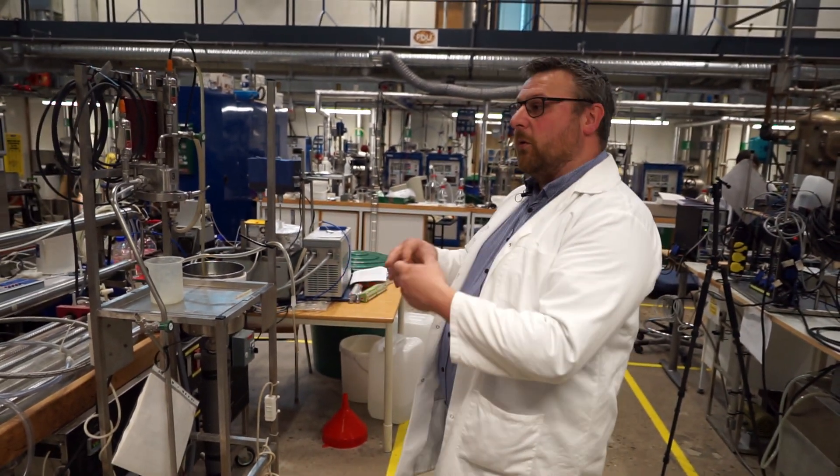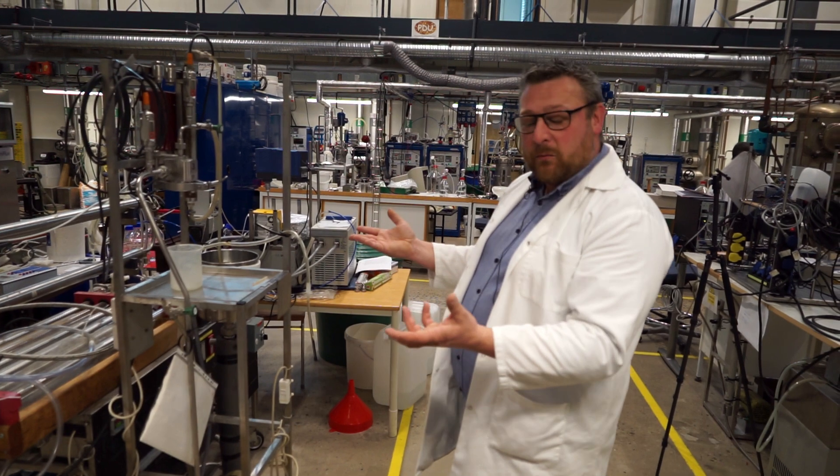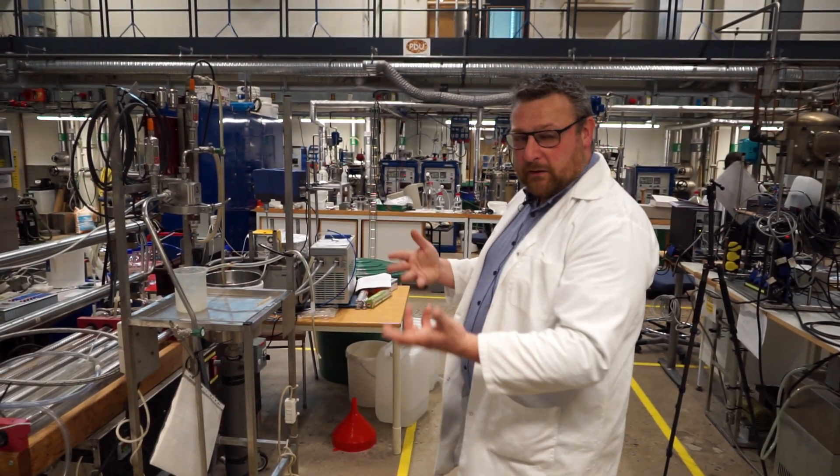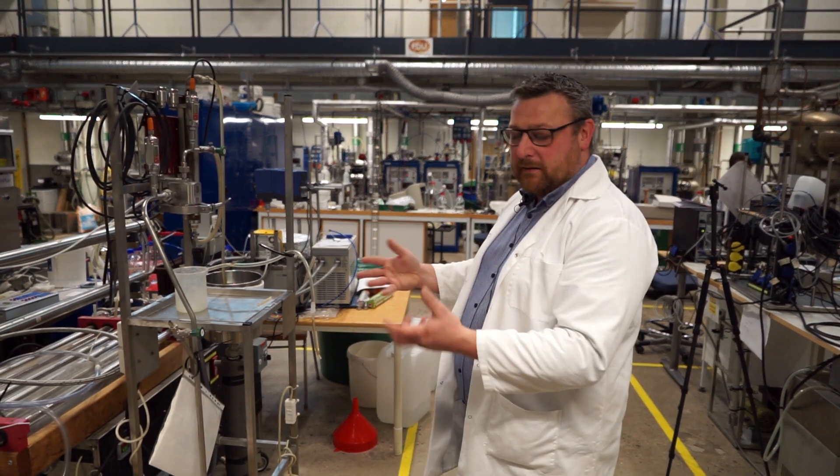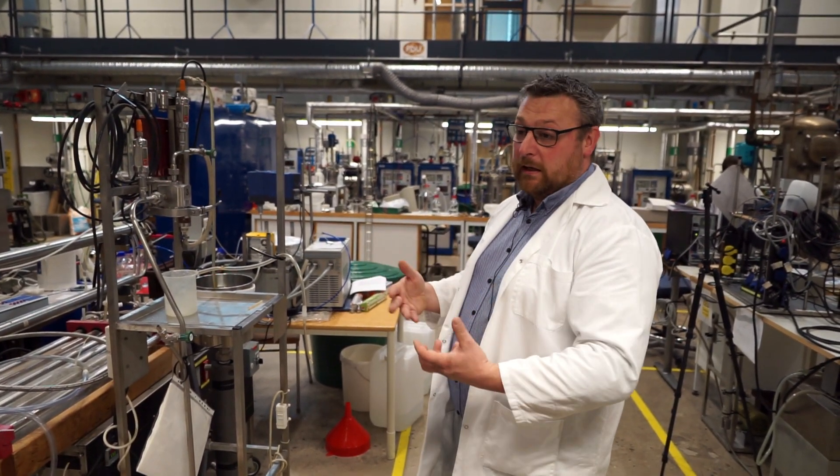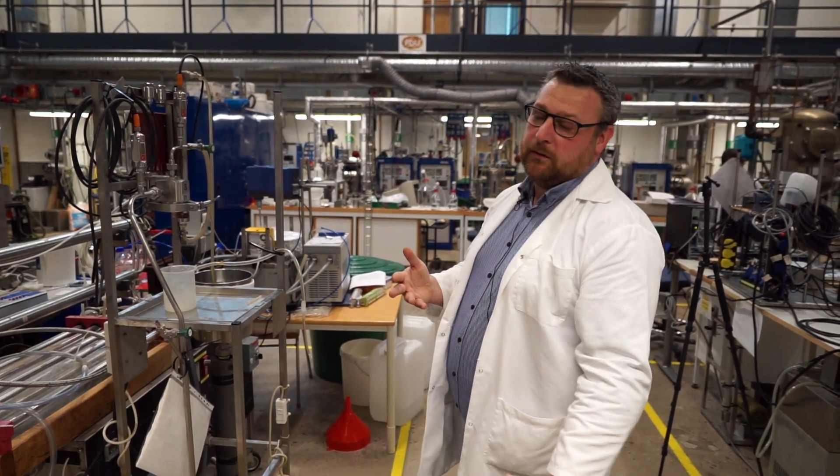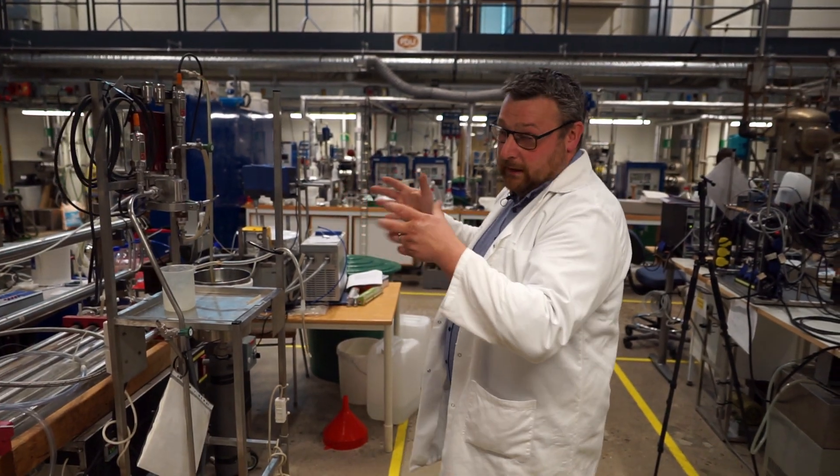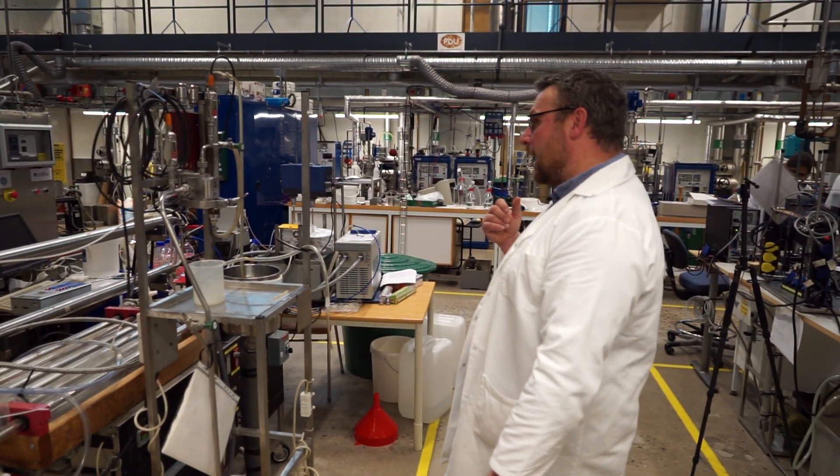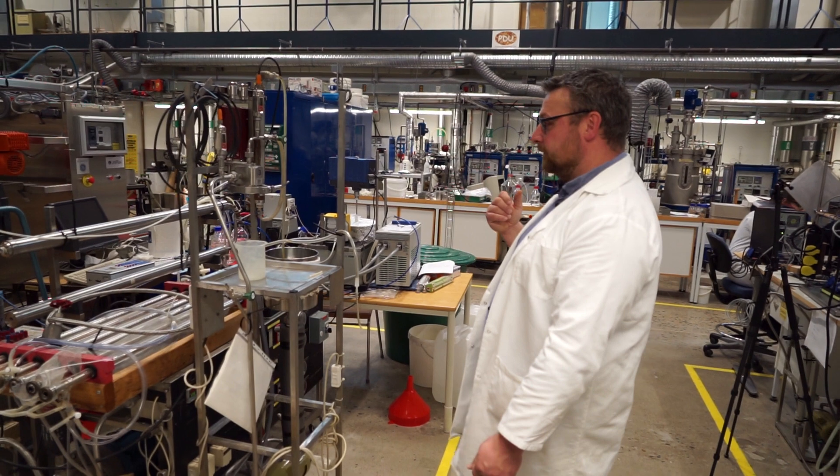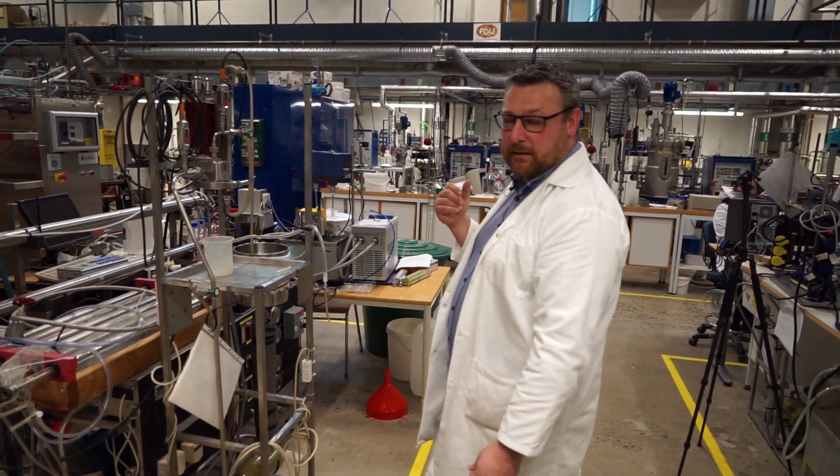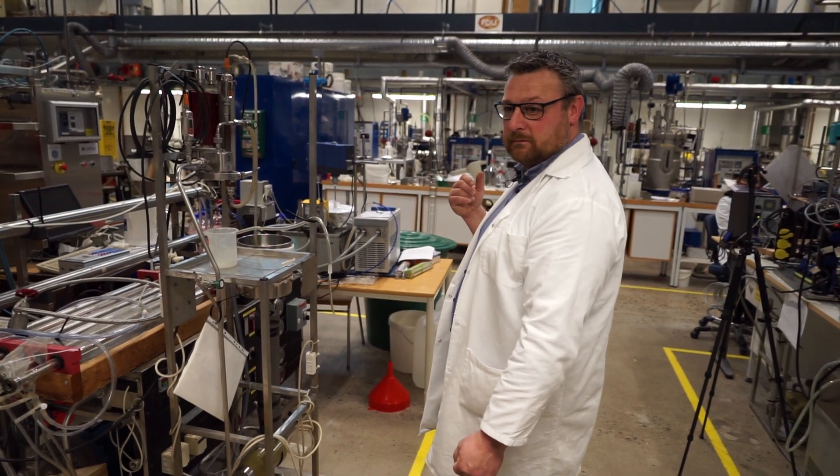Ideally, you would clean everything between all the experiments. But when you do the first set of experiments, you want to do it fast to get an idea of what's happening. Yeah. And then you can say, okay, let's not go that far down in cross flow. Let's keep ourselves at this level. Okay. Is there anything we should add? I don't think so. I think we're pretty much set now. Okay. Good. Thank you.